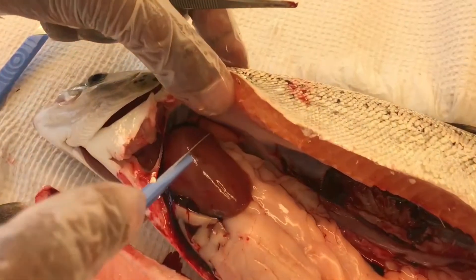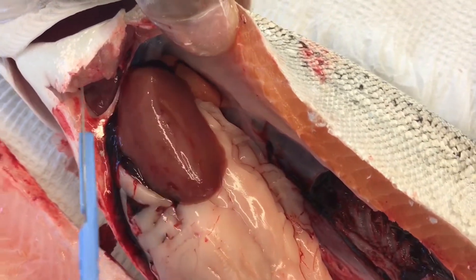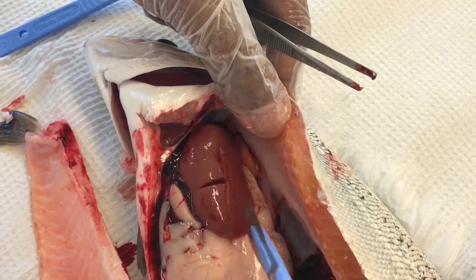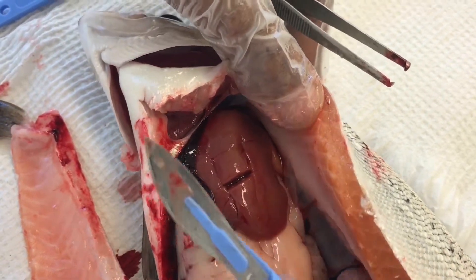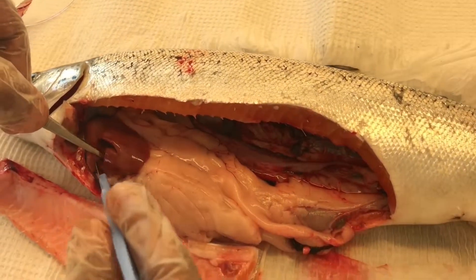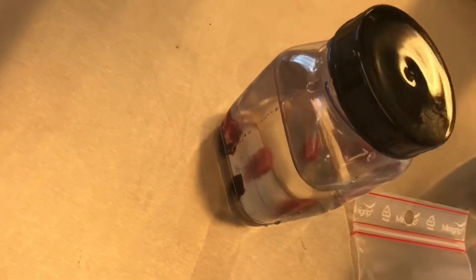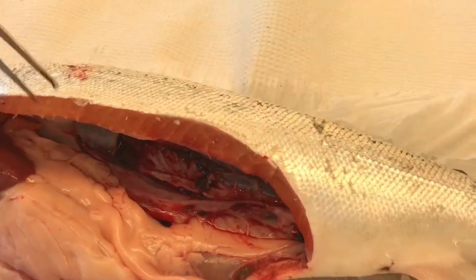Here we have the liver. We have to assess its color, whether it is swollen, and whether other lesions are visible. From the liver, incise approximately 1 cm by 1 cm. The thickness for all organs destined for histological examination should be no more than 3 mm, because that is very important for the fixative to penetrate for proper fixation. So we took samples from the liver, kidney, and spleen. Next will be the heart.